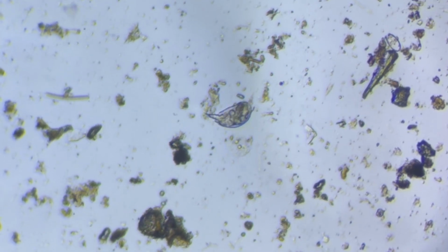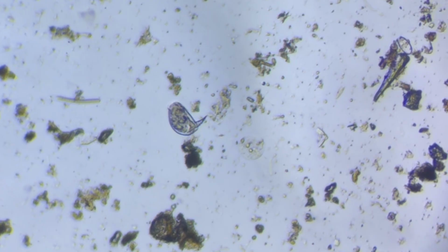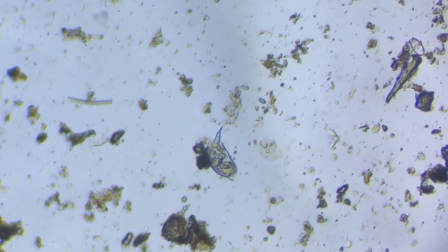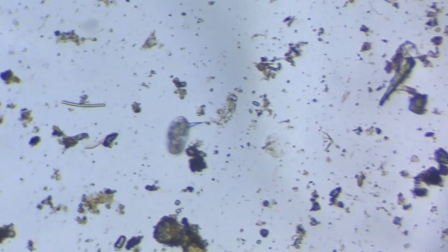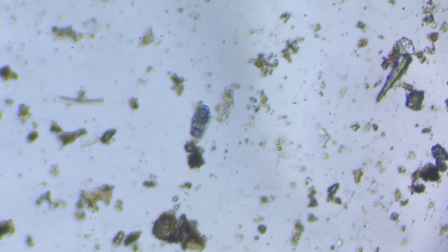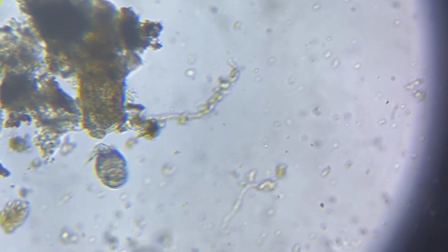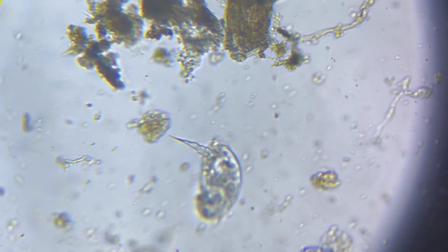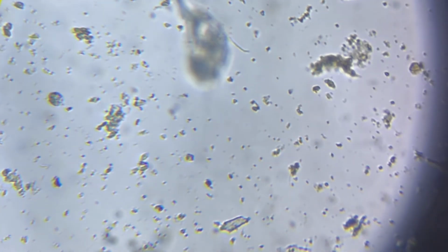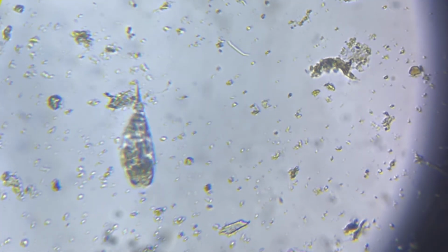Now, on our hunt in the Microverse, we managed to find a different species of rotifer. Again, this rotifer is closely related to the previous rotifer that we saw, and it's got a lot of similarities. However, here you can see that it's got a small little tail. Now as we zoom in, using a different objective lens, you can see the vast complexity that exists in this tiny rotifer. You can see its little organs and just about see its little rotating jaws. You can also see that it's eating, hunting for food.